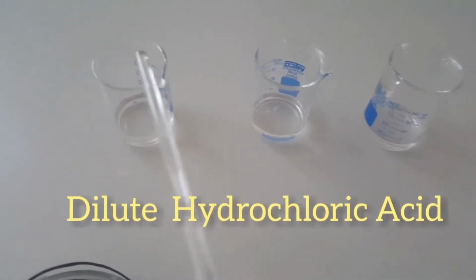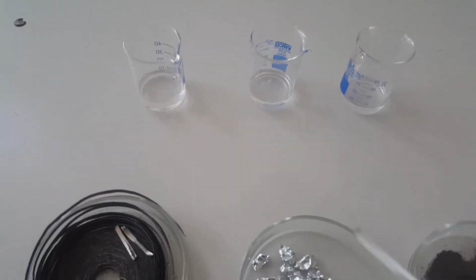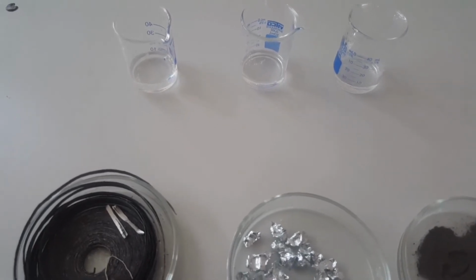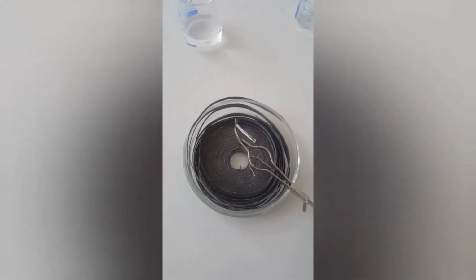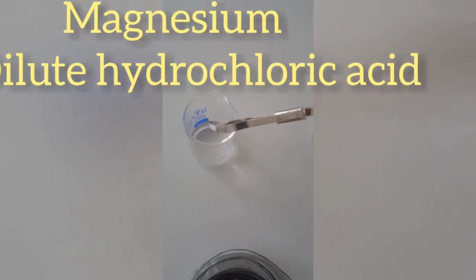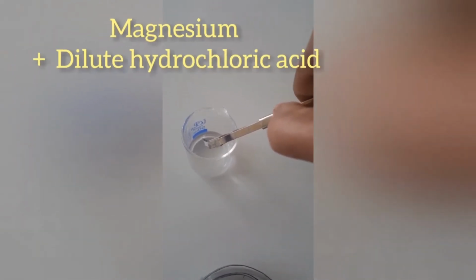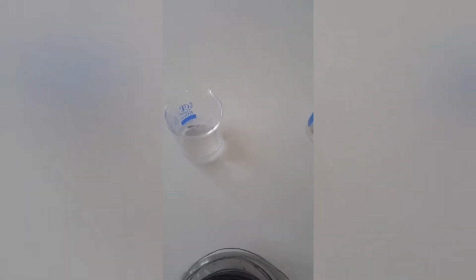Now take a magnesium ribbon and put it into dilute hydrochloric acid. I have taken the equal amount of dilute hydrochloric acid in these three beakers. Now add a small piece of magnesium into dilute hydrochloric acid and see what is happening. As you know, magnesium is a reactive metal, it reacts vigorously. You can see some kind of bubbles are formed.